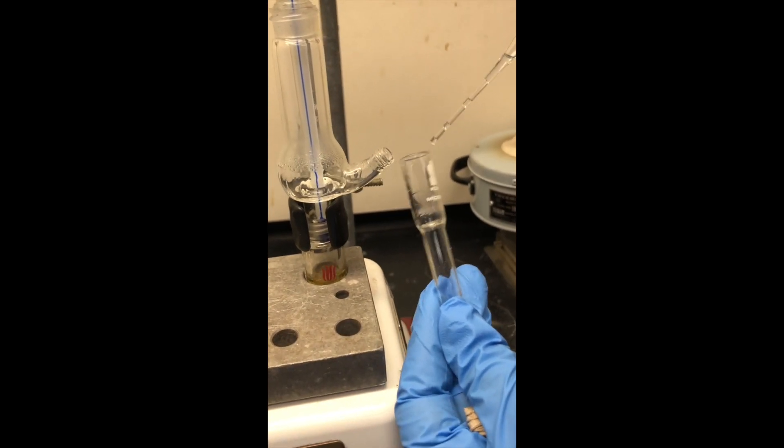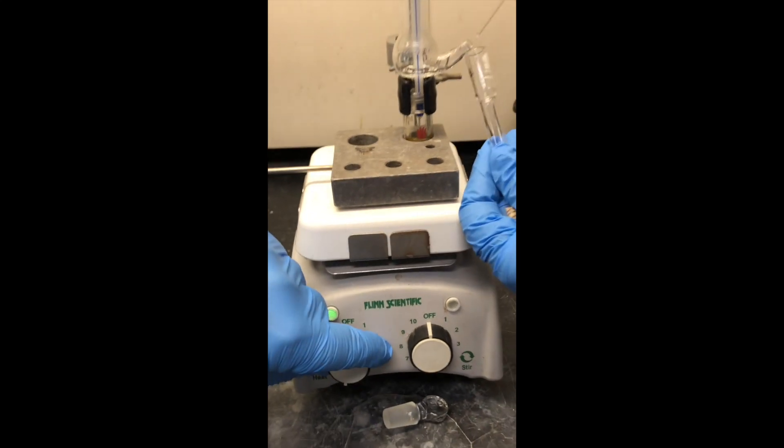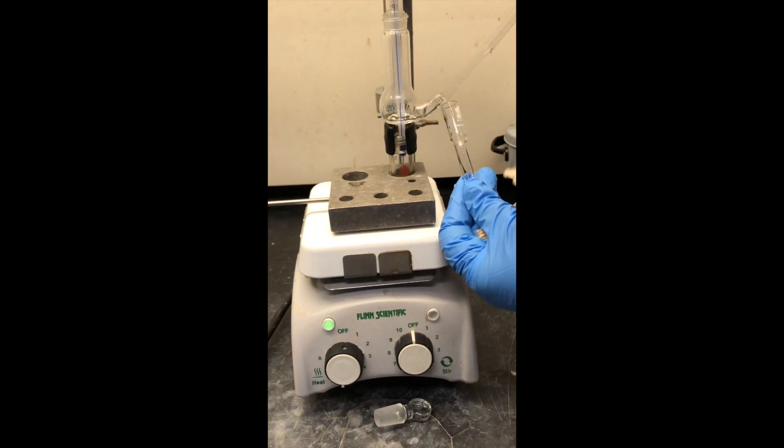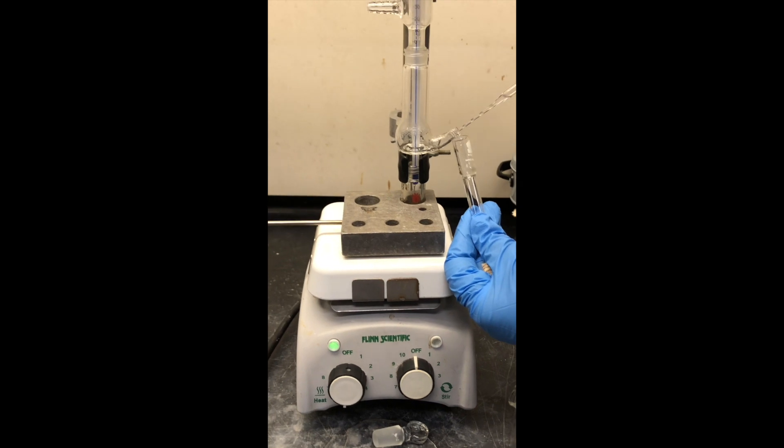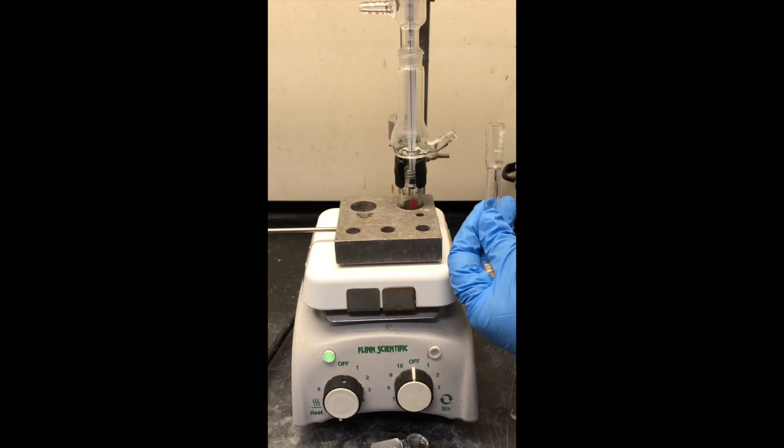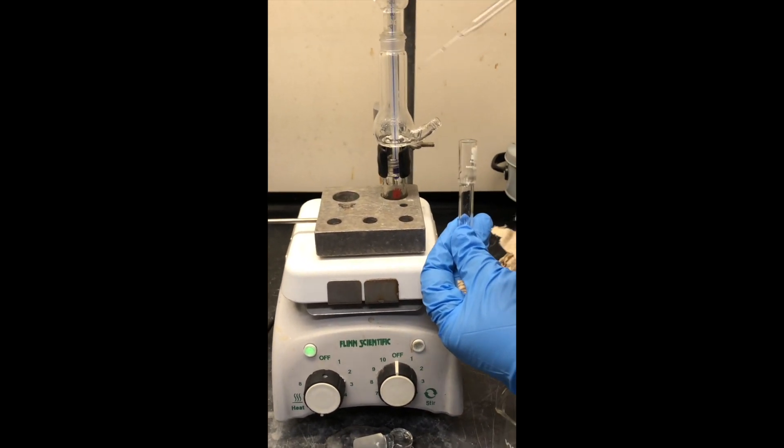We also need to watch that we're not evaporating to dryness, perhaps turning down the heat slightly so if the evaporation is going too quickly, we don't want to burn everything to a crisp in the bottom. It looks like we just did.